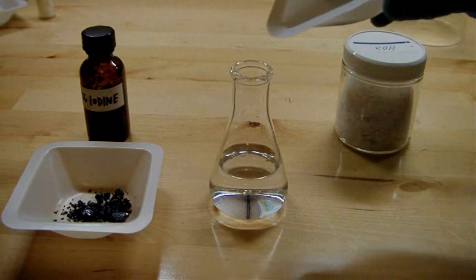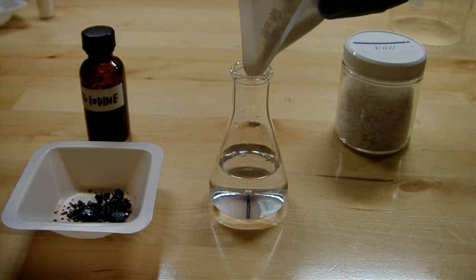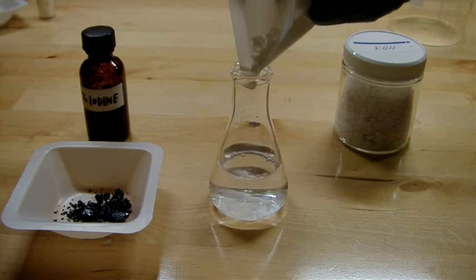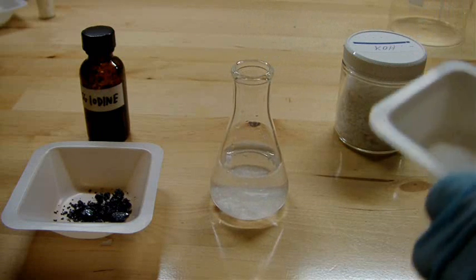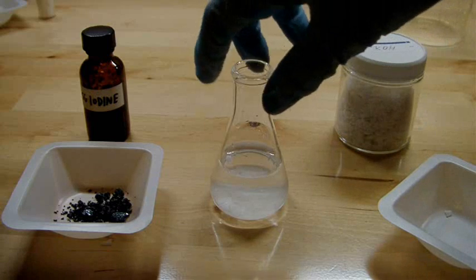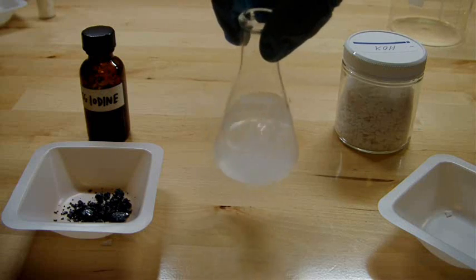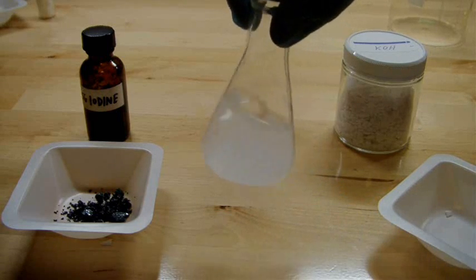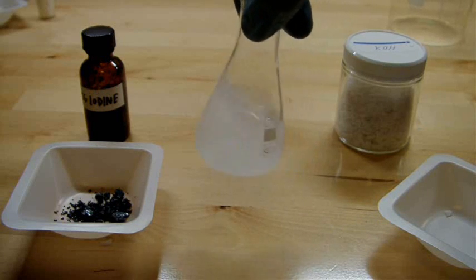Hopefully I shouldn't need to worry about heating this because the reaction of the hydroxide with water generates quite a bit of heat on its own. And sometimes it's actually enough to boil the water. So that's heating up quite a bit nicely on its own, so I shouldn't have to do any supplemental heating.